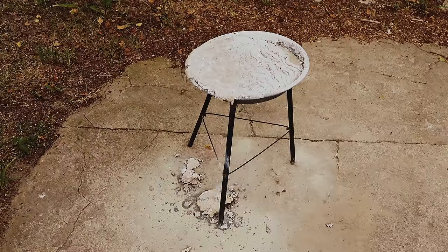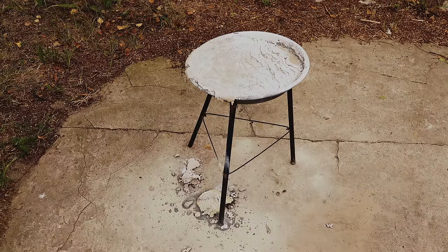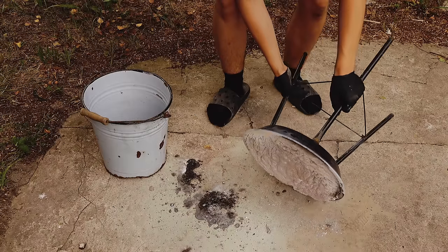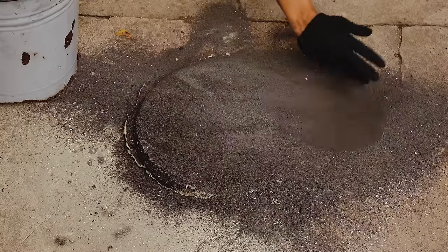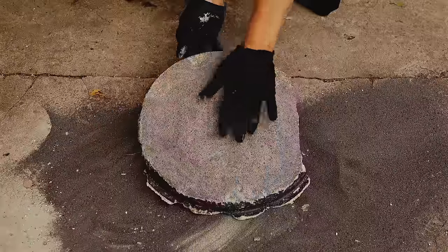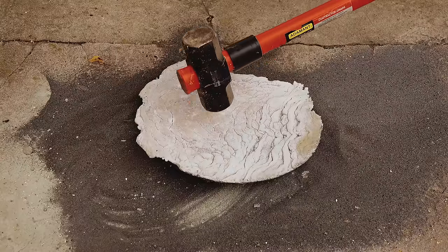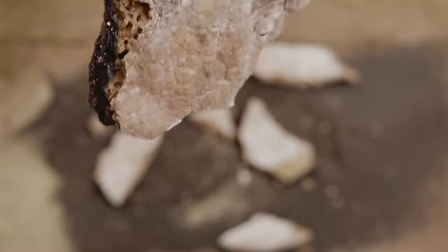After about an hour, the slab completely solidified and cooled down enough to start processing it. To get the silicon out, I have to selectively dissolve the aluminum sulfide encasing it, and this can be done by just soaking everything in some water. First, however, I had to get the slab out of the grill, which at first seemed rather hard, but fortunately after flipping the grill over and using some finesse, everything fell right out. The protective sand had turned black for some reason, and I had to dig out the slab from it like some sort of an archaeology project. Its texture and sounds really reminded me of ceramic. Before dissolving away all the aluminum sulfide, I had to break it up into smaller pieces so it could fit in my bucket. I used my gigantic hammer, which combined with the slab being rather brittle, made quick work of it. It already uncovered some pretty silicon crystals, and I just couldn't wait to see the silicon blobs in their full glory.